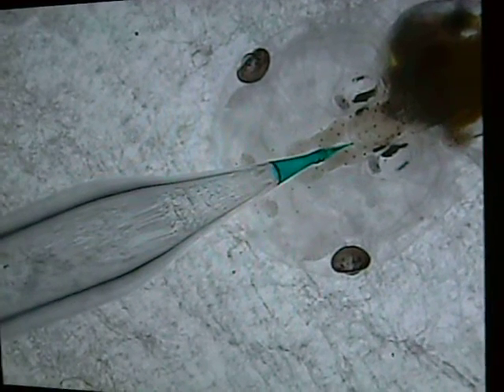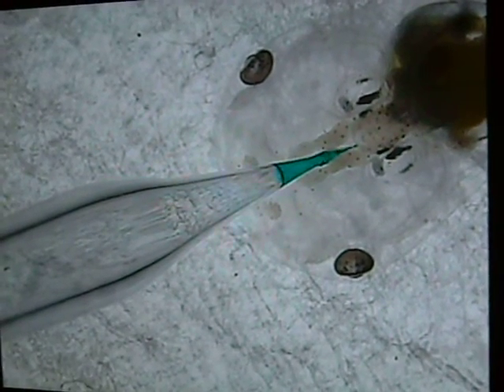Not much is coming out. A little bit longer pressure. Okay. Go ahead. So, you've worked out all these parameters, right? Yeah. So, you're probably just pushing up against something which is preventing the dye from coming out. So, should I back them up? Yeah.